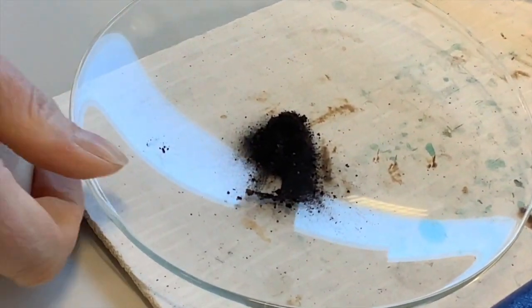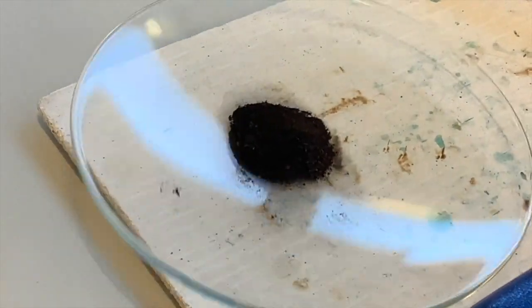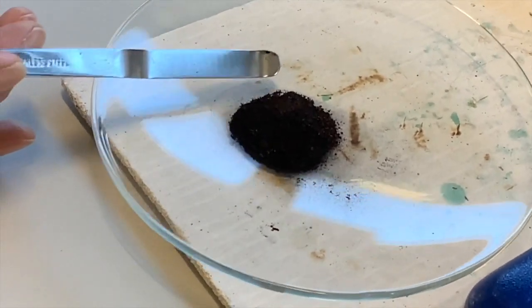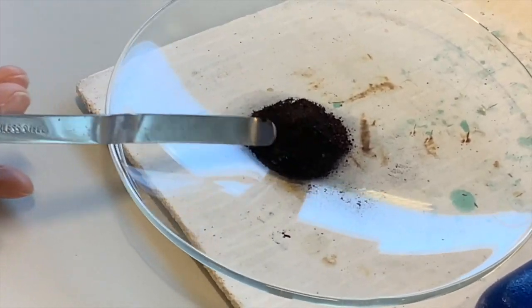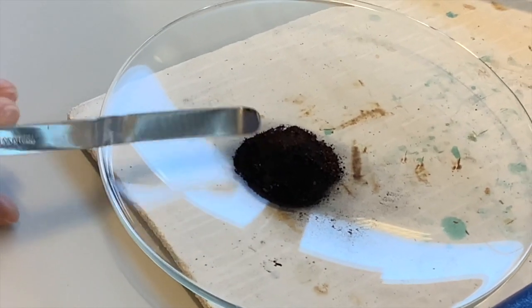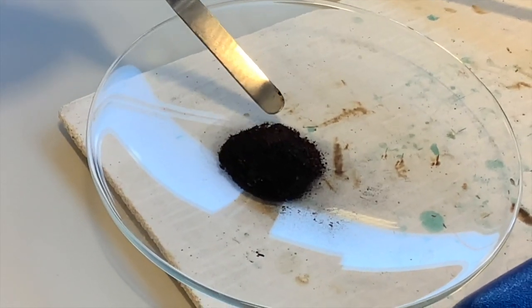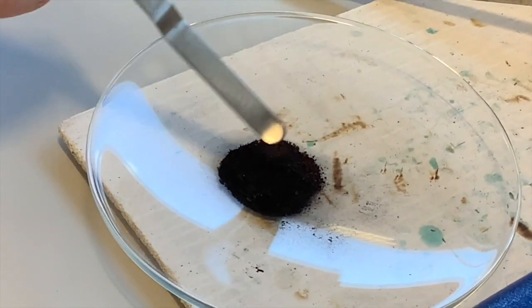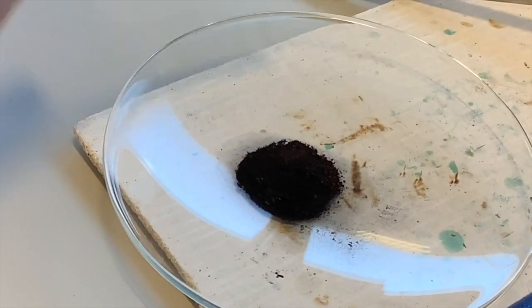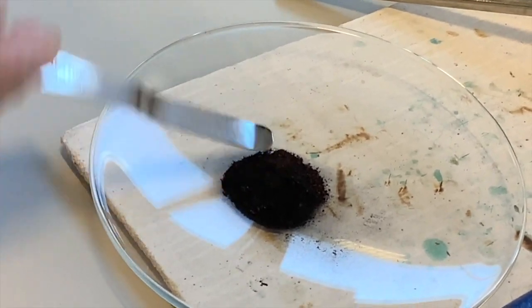It might be hard enough for you to see it. I'm going to shake this to see if we can get any big lumps to come to the top. And so probably quite hard for you to see, but the colour of this to me is now looking much more red-brown. So there's still a lot of black carbon because I put in lots. We say that's using a reagent in excess, so I put in loads. And the copper that's forming is just where my spatula is pointing. And so you would need to do further separation, use your separation techniques to try and get that copper out. And maybe heating it up again and really making it molten to try and separate the copper. But the copper's definitely there.